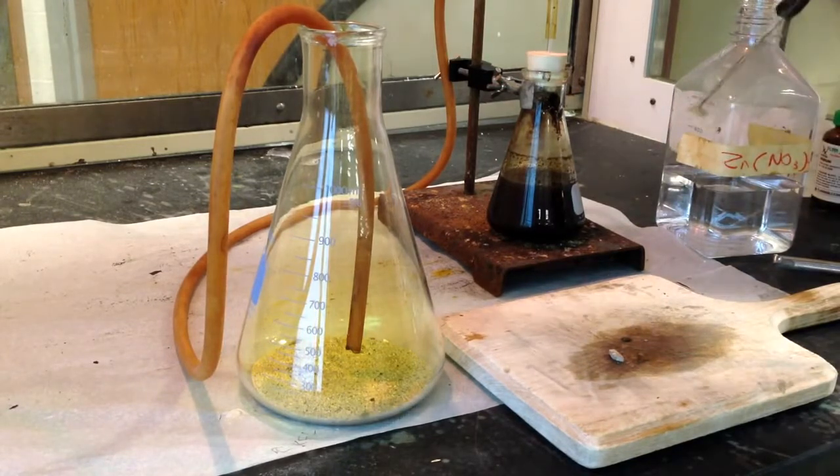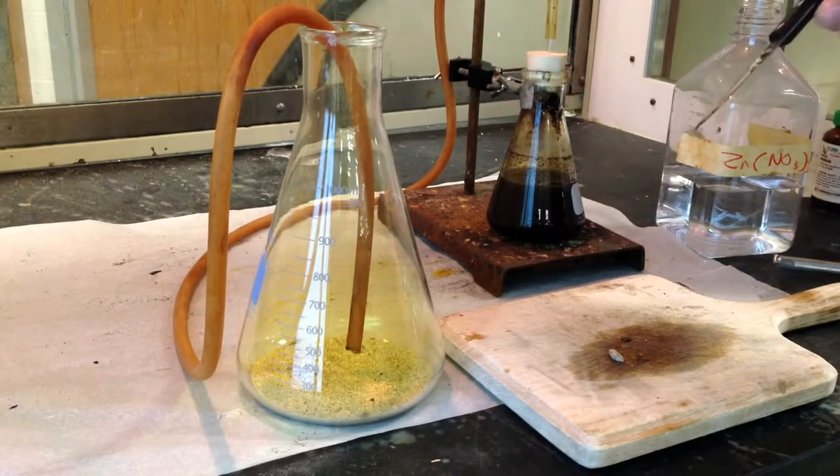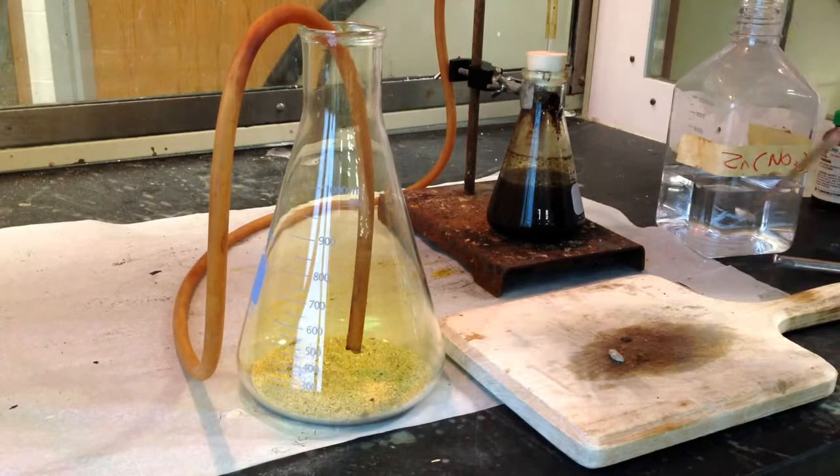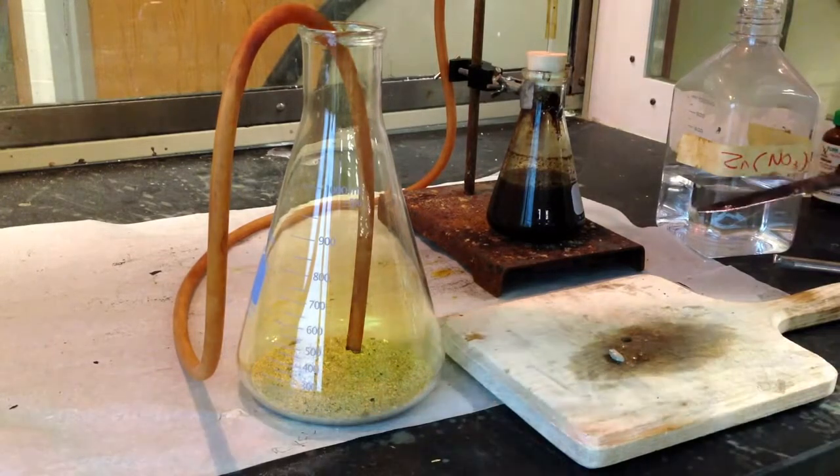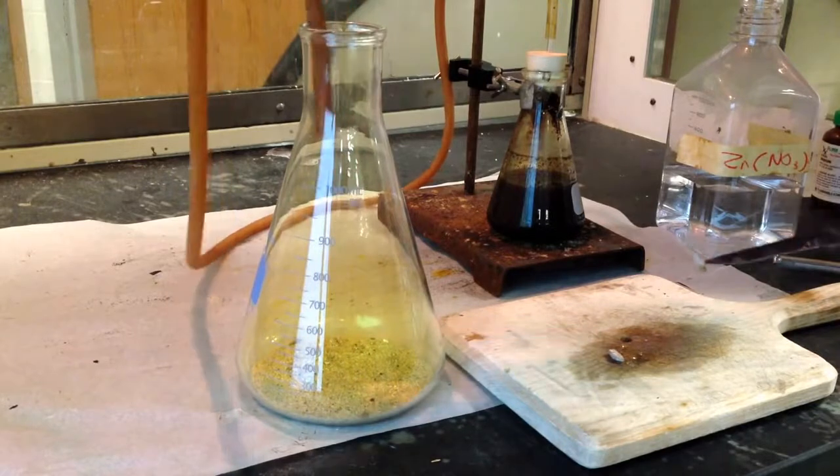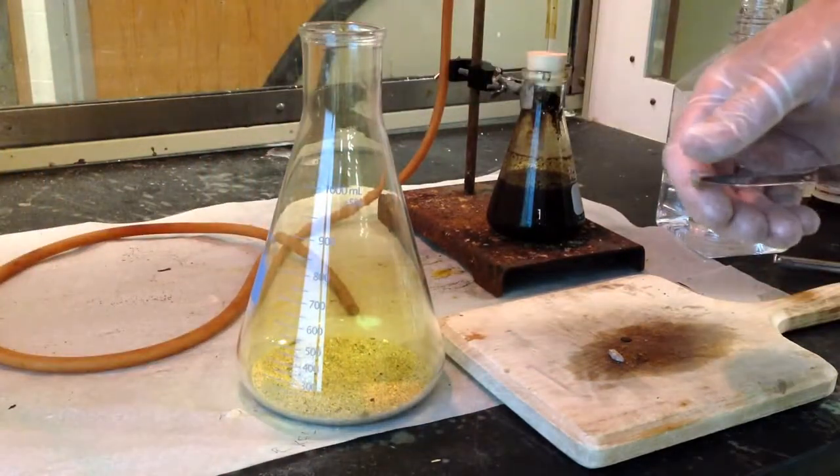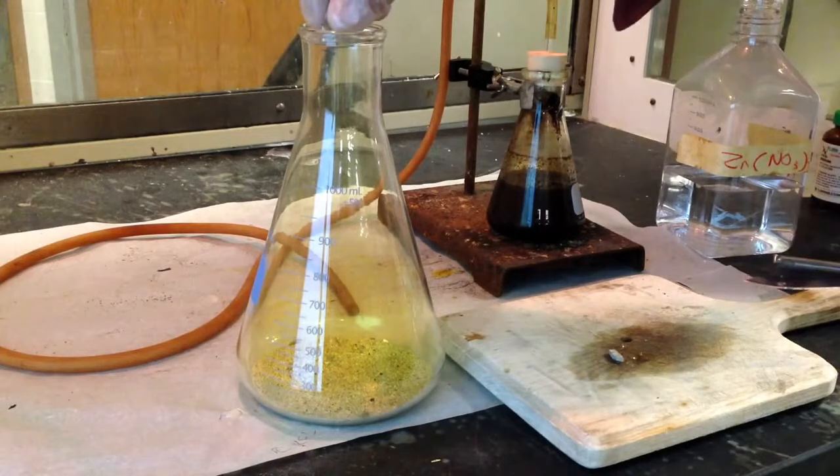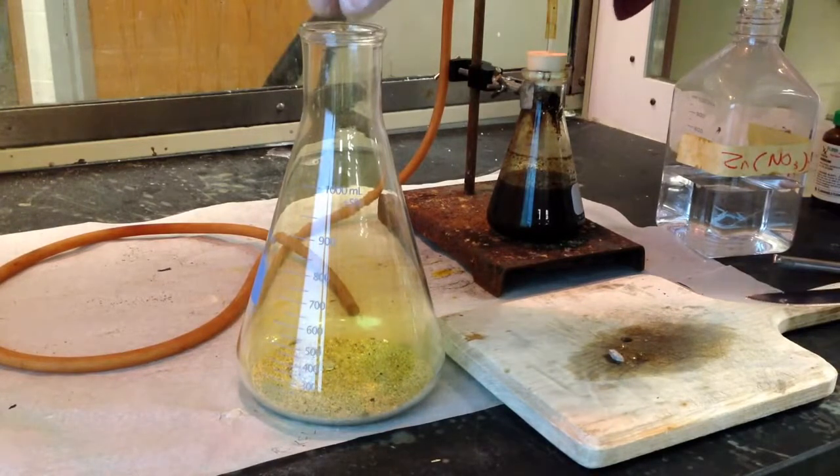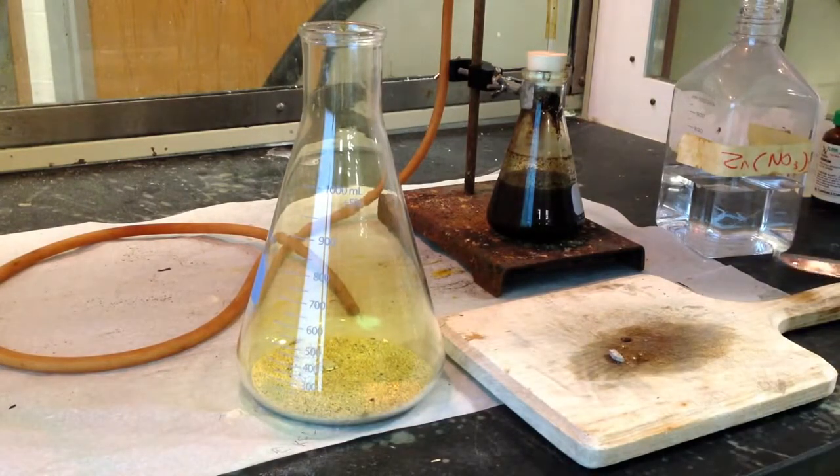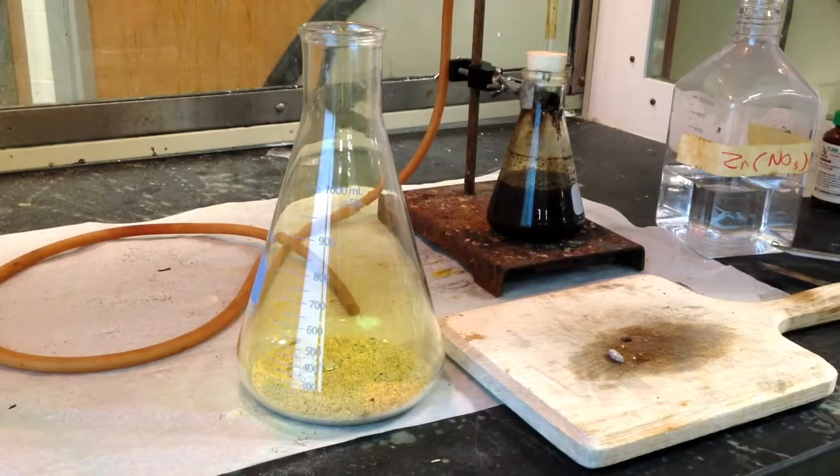Now, it may react right away. Chances are that it won't. So I'm probably going to have to put a little bit of water on it. So I'm going to take out my generating tube. I can see my yellowy flask, and I'm going to take my piece of sodium, and I'm going to drop it, hopefully, right in the middle. I'm going to reposition my camera a little bit.